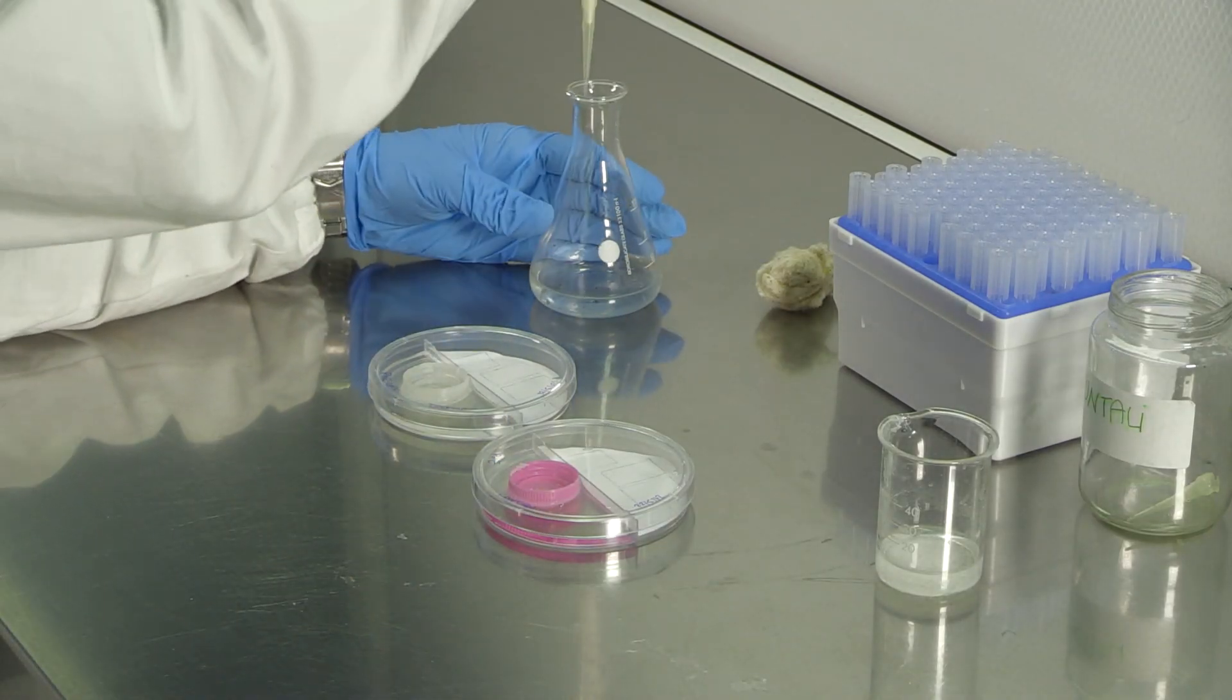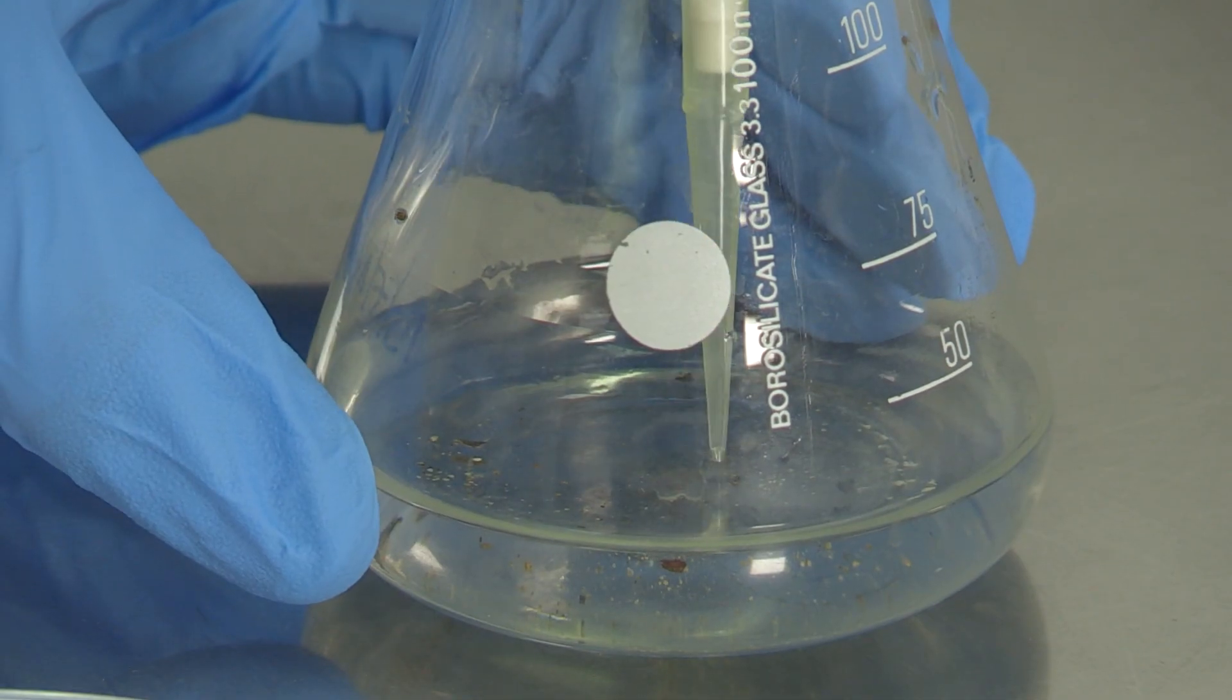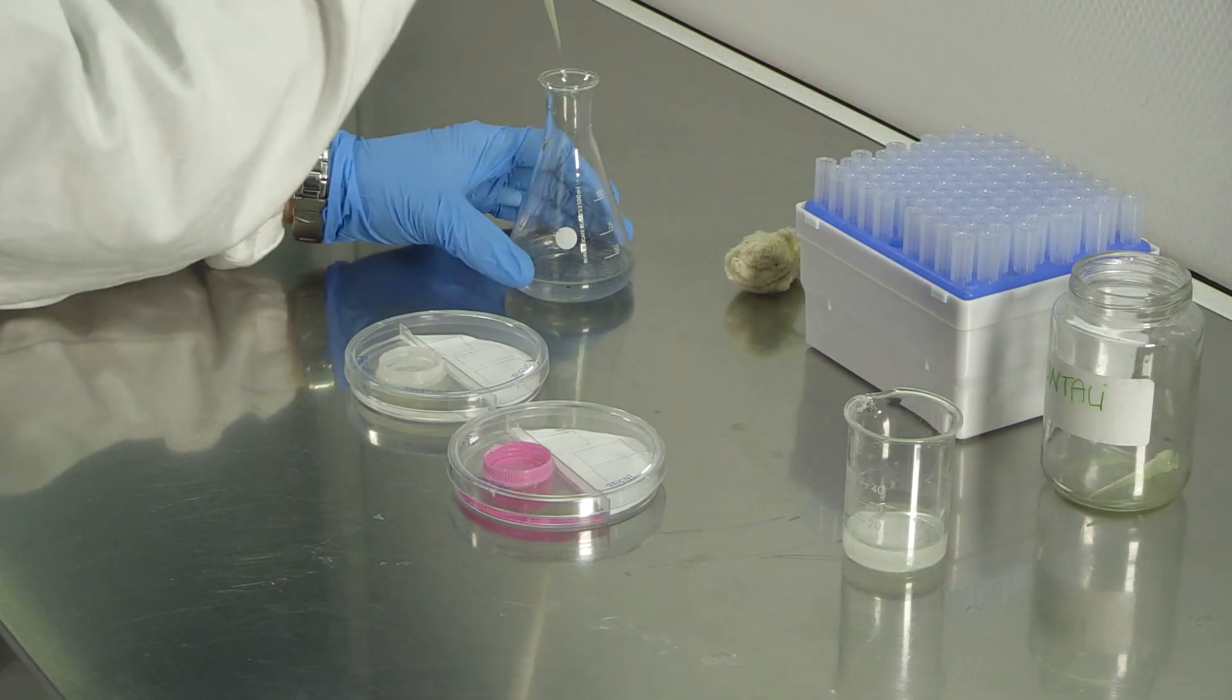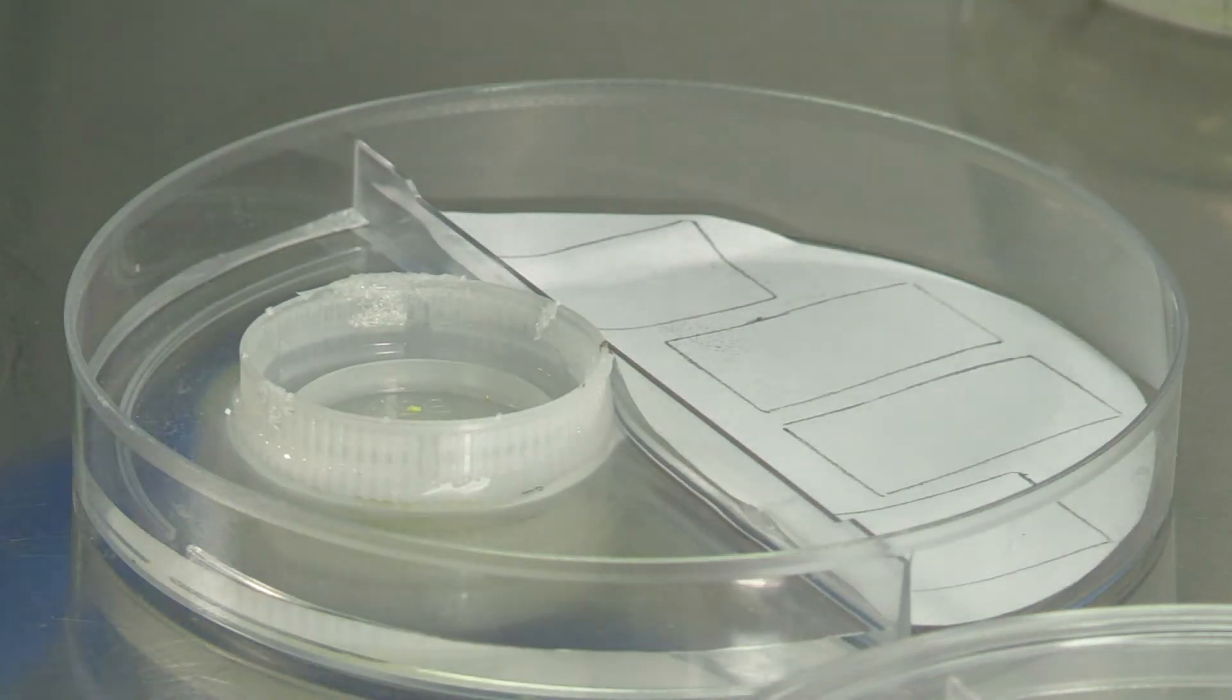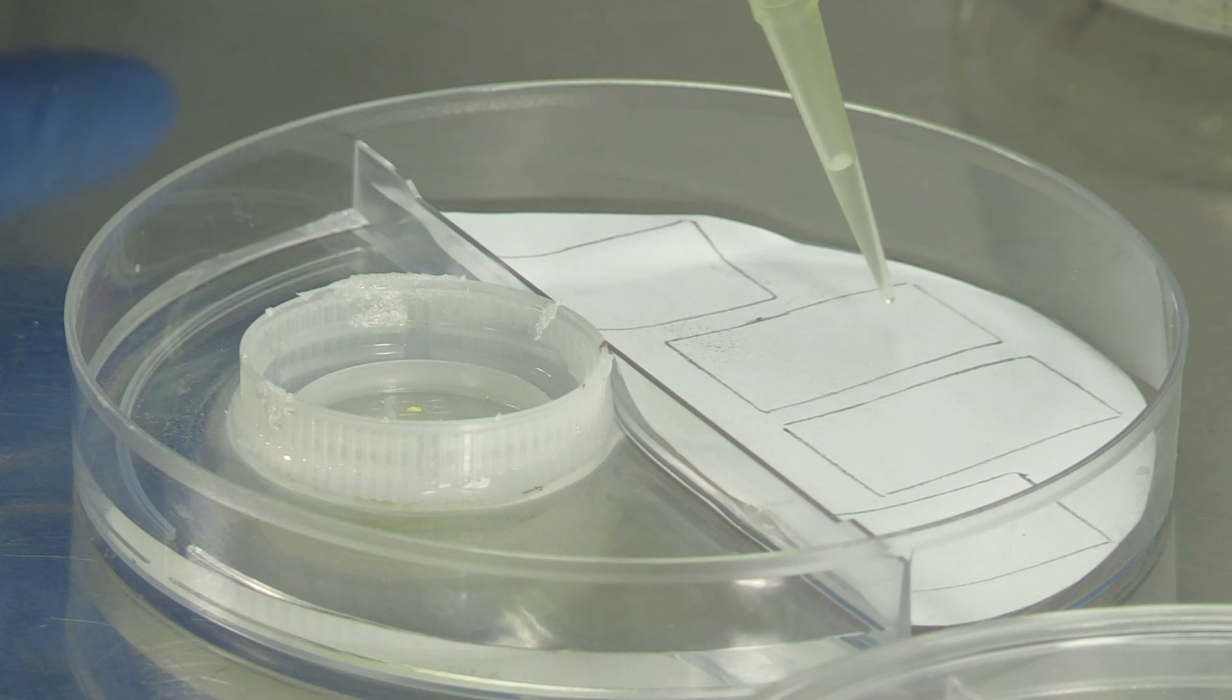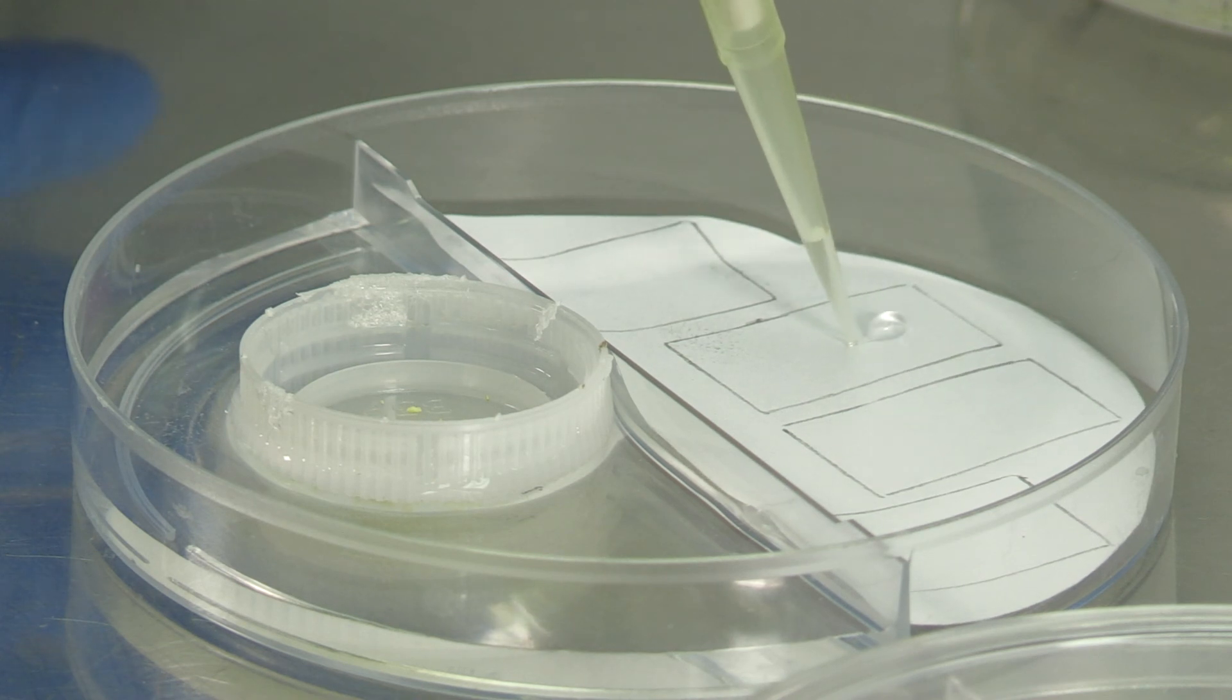A fungal suspension of known concentration was prepared ahead of time. An aliquot of this suspension must be pipetted onto each rectangular square previously outlined on the paper samples.